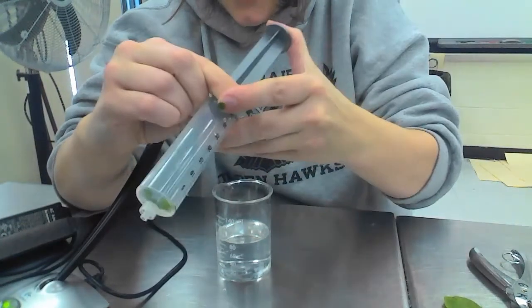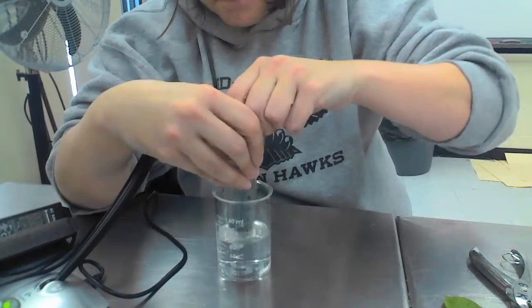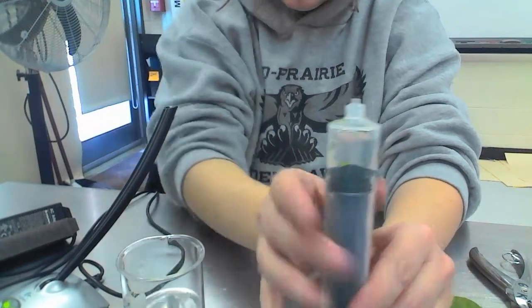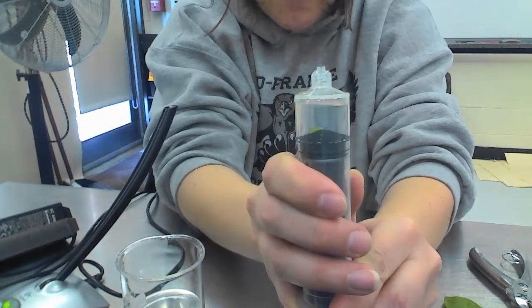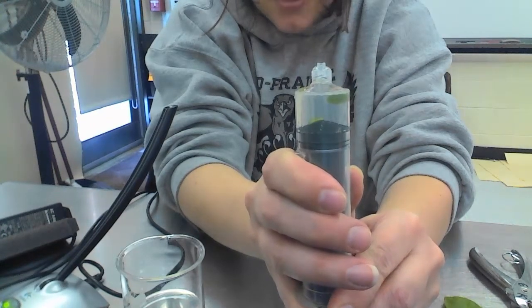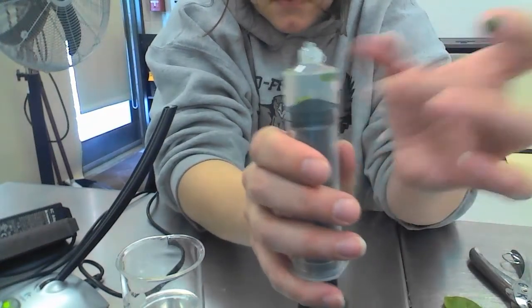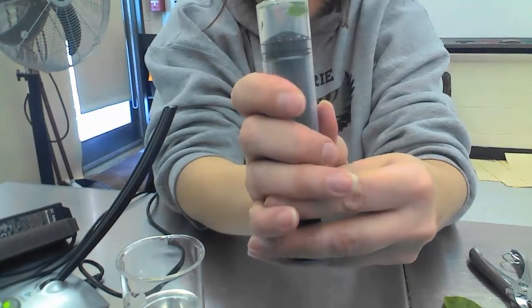And I'm going to put the plunger in. Now I'm going to get some water. Now what we want to do is get all this air out. As I said, the leaves have air pockets, so we want to get all the air out of that, and we're basically going to create a vacuum. So I'm going to get all the air out. And you need to flick it a little bit just to make sure you get all the air bubbles out.